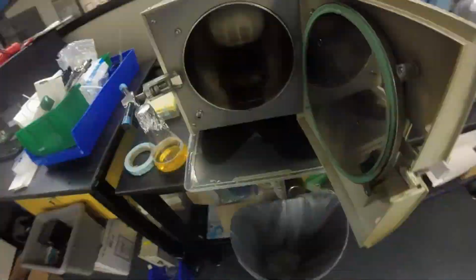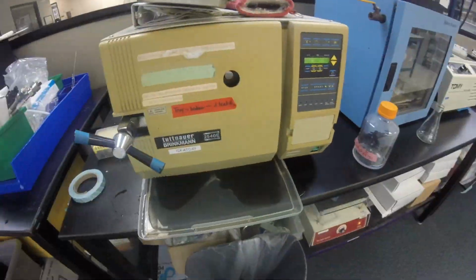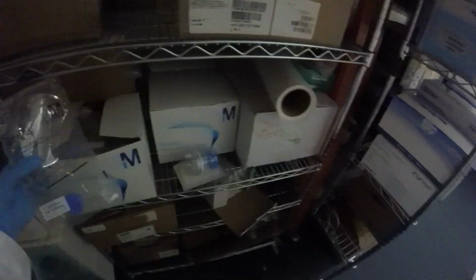Basically, I made a bunch of media. I then poured them into some 50 milliliter conical tubes. But then on one of the 50 mils, I inoculated it with a colony. And we'll get back to maybe why I did a colony. I didn't have any liquid media on me, but this is actually probably a big source of error and why this lab didn't go exactly how I wanted. Let me actually just put up the plot.